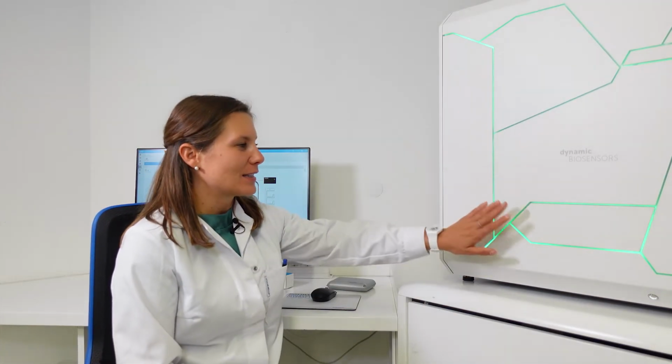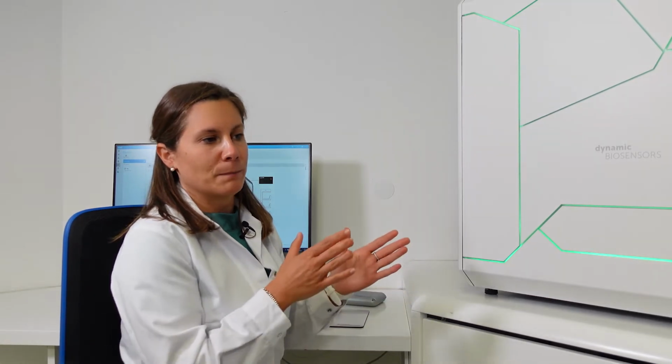Now that our sample tray and the chip tray have been injected, we can move on to our heliX software, which permits us to control our system, design our experiment, and analyze our data to set up our tight binder kinetics. You will see it's a very simple and straightforward setup because, as I mentioned before, we will do 1 single functionalization with streptavidin, and then we will follow 1 single association of biotin hydrazide and a very, very long dissociation. We're talking about a 12-hour dissociation. So overall, in terms of hands-on time, we're talking about 10 to 15 minutes, so it's really, really easy. Most of the job will be performed by our heliX instruments.